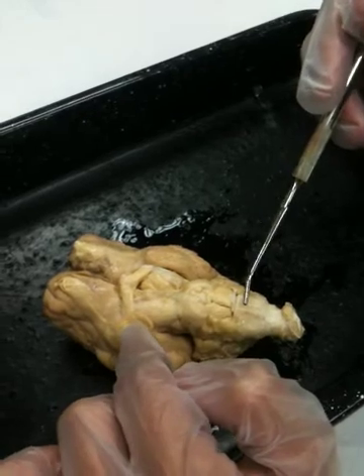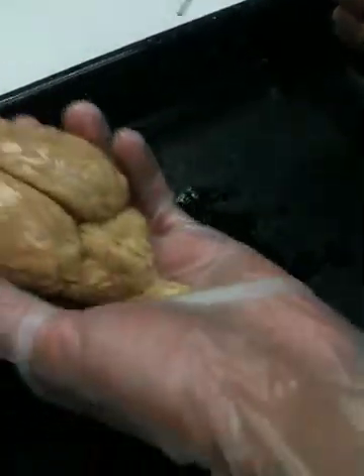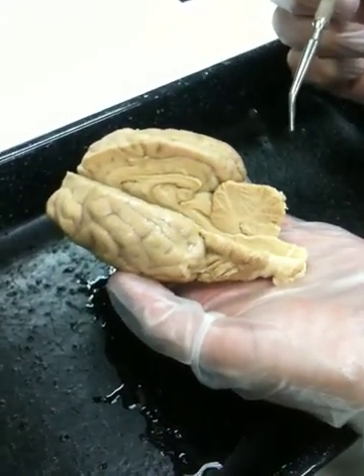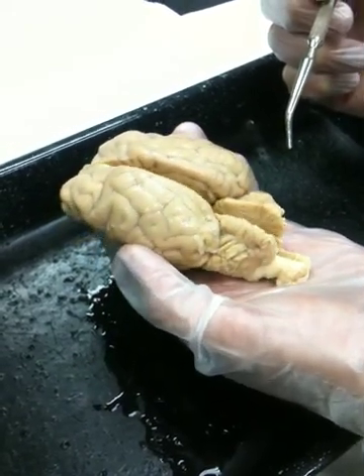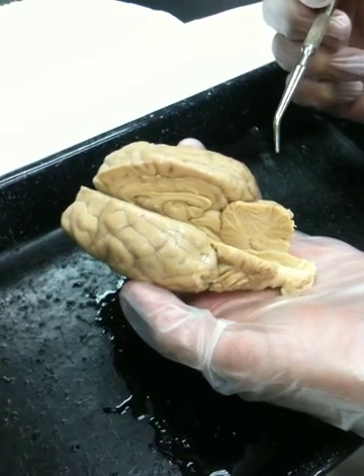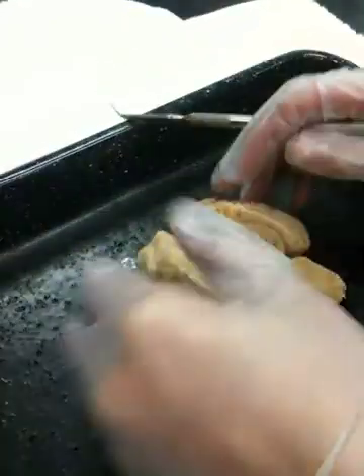Having located those external structures, we're now going to look at the internal structures. We're going to take a sagittal section, so you're going to cut your sheep's brains right down through the great longitudinal fissure, and continue your incision right through the cerebellum and down through the spinal cord so that we fold the brain open into two halves. When you make this cut, do it with a minimum amount of back and forth sawing. Try to make one nice, sharp, smooth cut if you possibly can. I've got a brain here that we have already opened, and we'll take a look at the insides. We're looking at an inferior view right now. If I turn it back over to the superior view, it'll fall in half like this when you've made your cut.